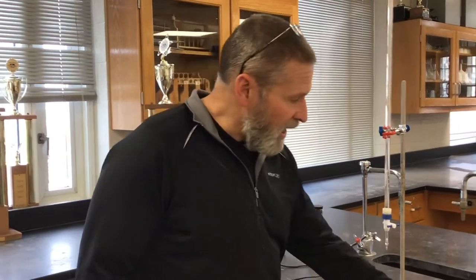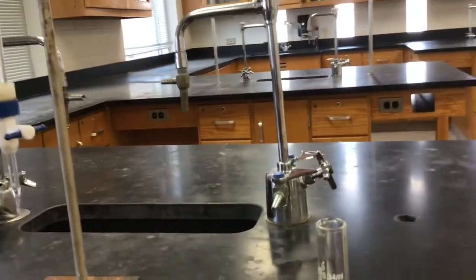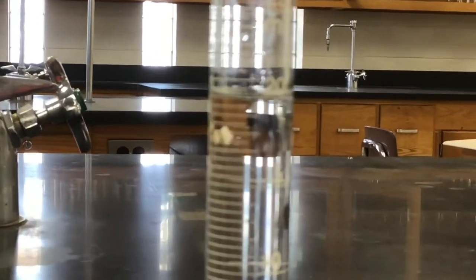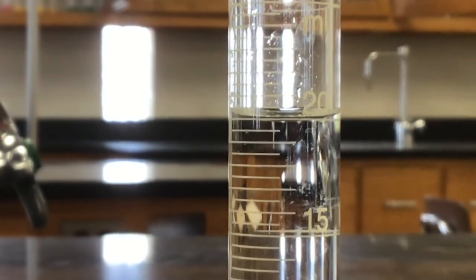Your goal is to use the data to create a titration curve, then use the titration curve to help figure out the concentration of the acid. We've got a strong acid here. You want to know the volume — hopefully it's right at 20 milliliters. Looks like you did a pretty decent job measuring. So that's the volume of your strong acid.